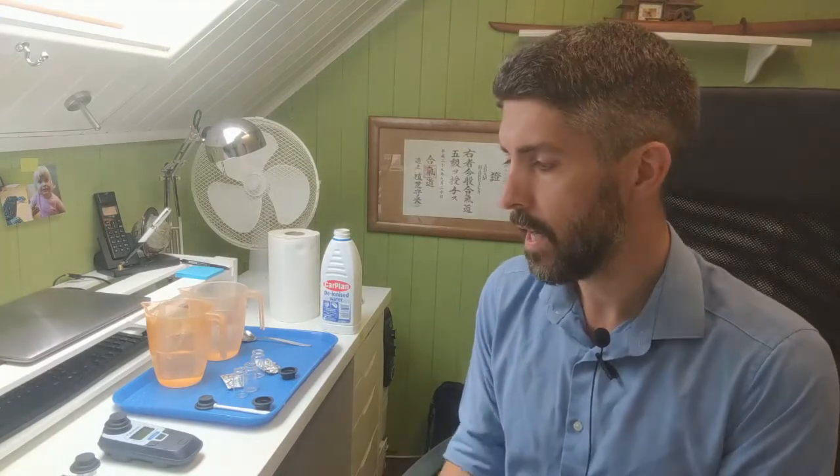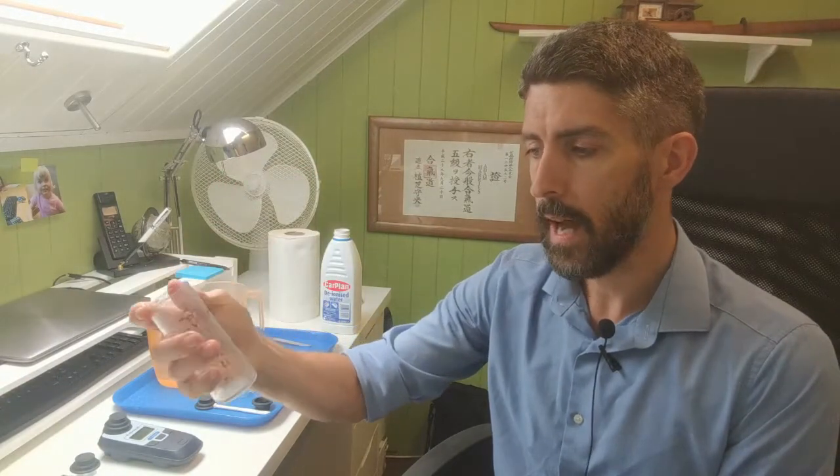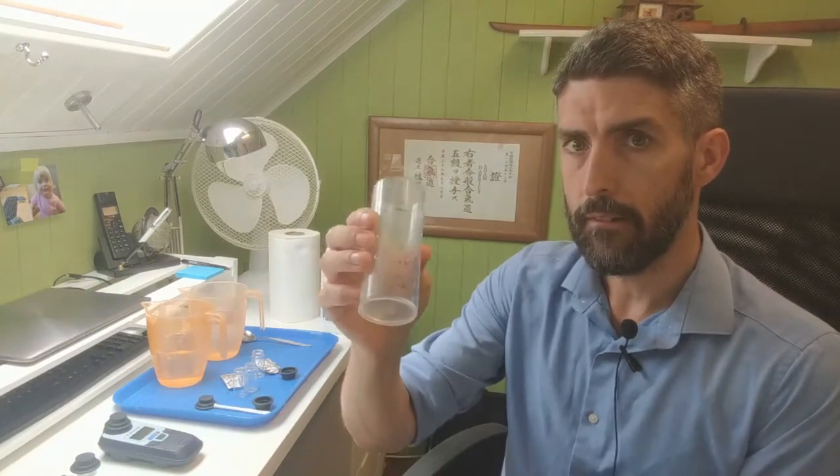So a chlorine smell is actually no indicator that you've got an appropriate level of chlorine. In fact, a chlorine smell is a good indicator that you've got high levels of combined chlorine, which is not a good thing. So that's how to perform a bleaching test when you've got a situation where an excess amount of chlorine in the water is actually bleaching out the colour of the DPD1 tablet. You basically dilute it with one of these beakers and you multiply the result you get with the photometer by the appropriate factor as given on the side of the test beaker.